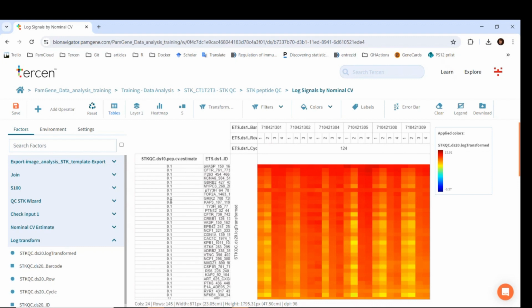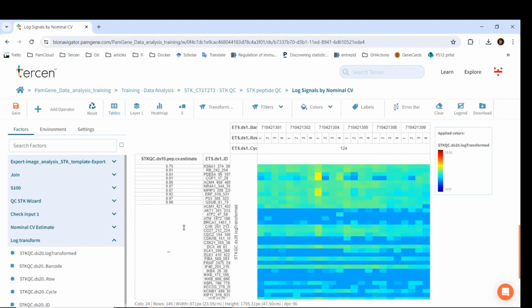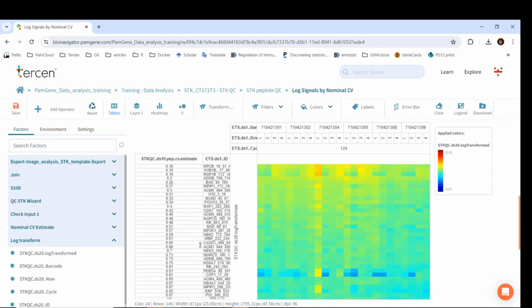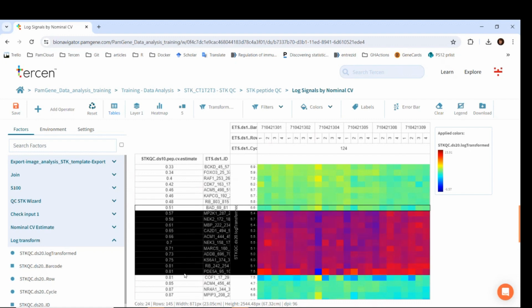Low CV estimates coincide with high signals, which are on the top. As we scroll down to higher CV estimates, the signal is lower. In the next steps, we need to exclude peptides based on a threshold on this pep.cv estimate factor. This threshold is 0.5, meaning that we exclude all peptides which have CV higher or equal to 0.5.